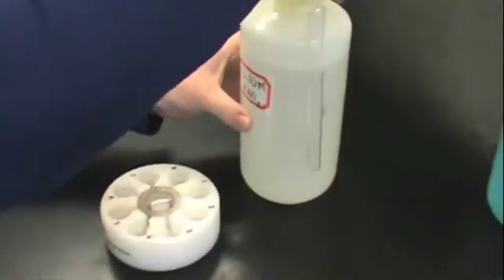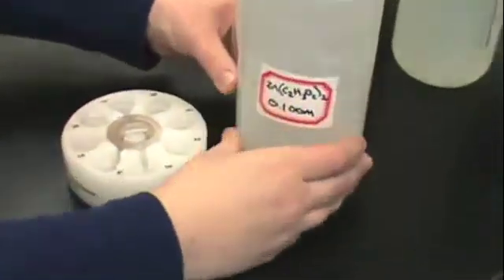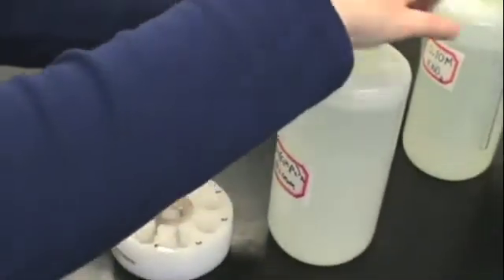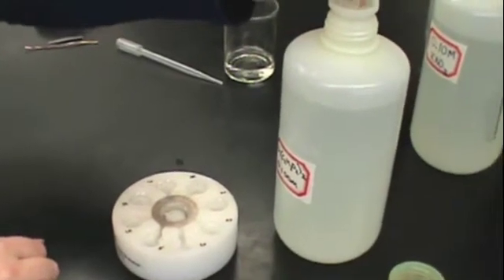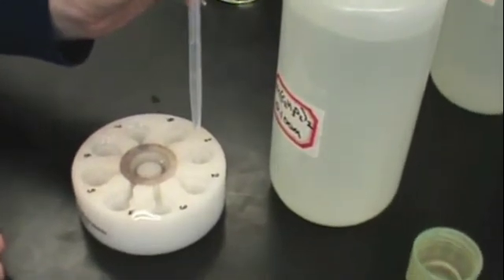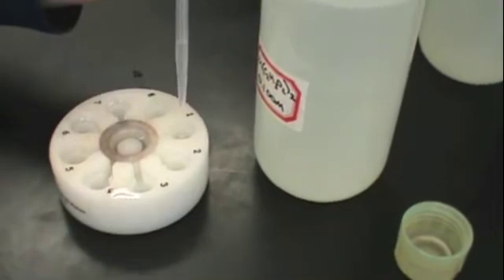After you have obtained KNO3, get the zinc solution for your half-cell. It should have a 0.1 molar concentration. Use the dropper to put the solution into one of the wells. Make sure that the liquid level in this well reaches up so that you make a connection with the salt bridge.